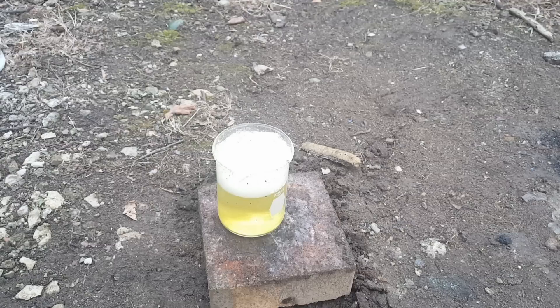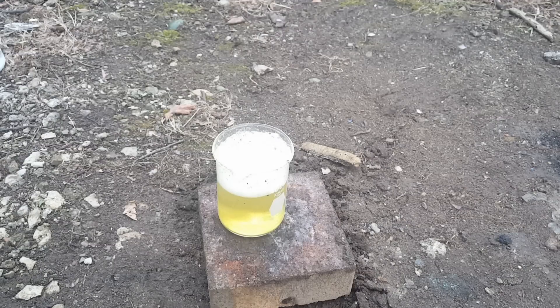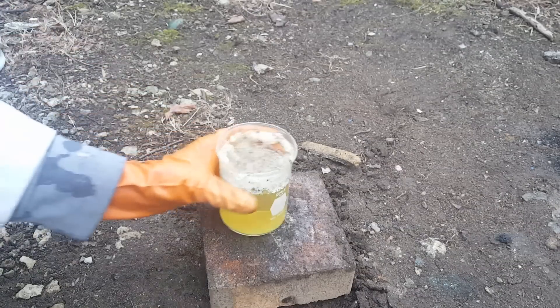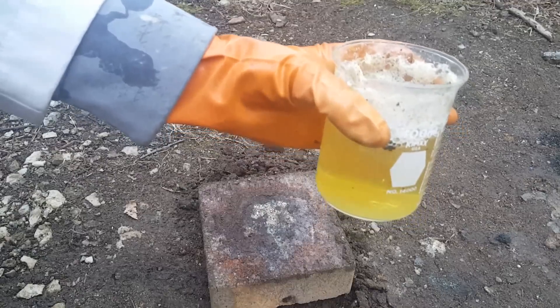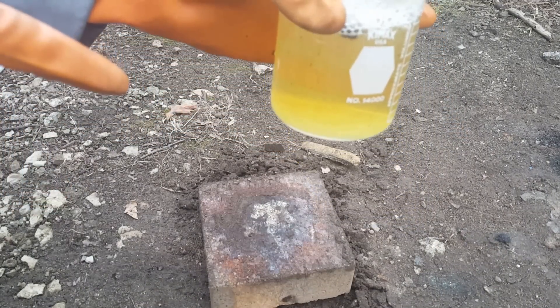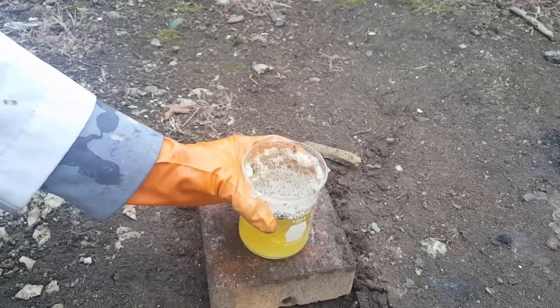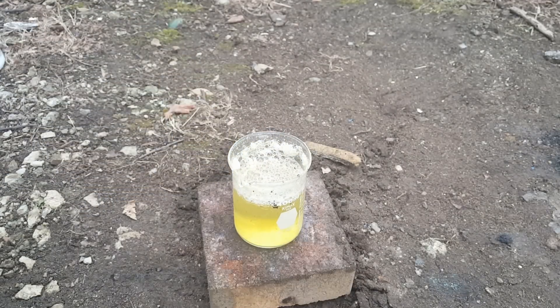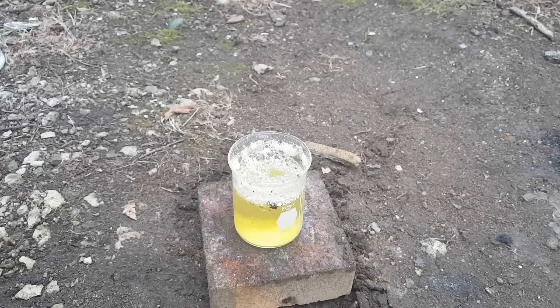I have destroyed most of the acid now. We've got a yellow solution right here remaining. The yellow comes from remaining dissolved chlorine dioxide. Chlorine dioxide — the yellow-green gas you were seeing mixed with chlorine — is a very unstable and explosive gas, but in solution it's pretty stable. It's used as a disinfectant, much like bleach is.